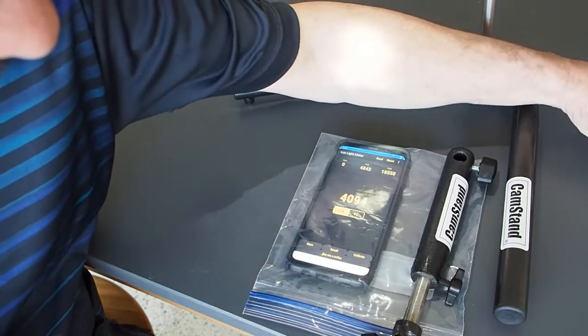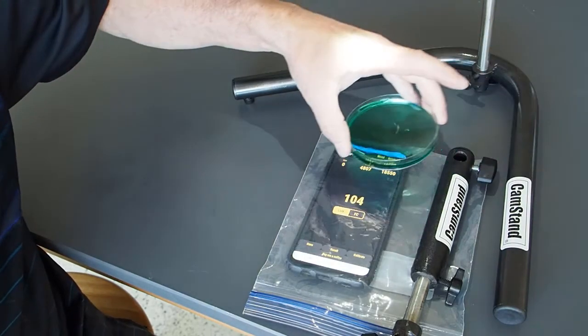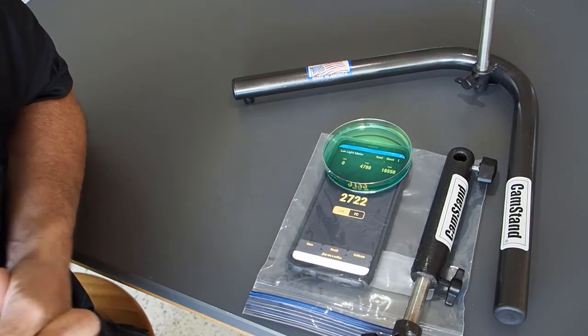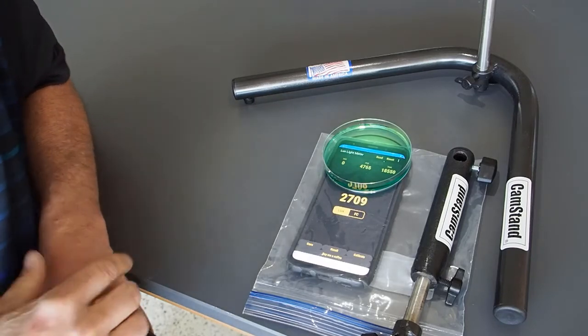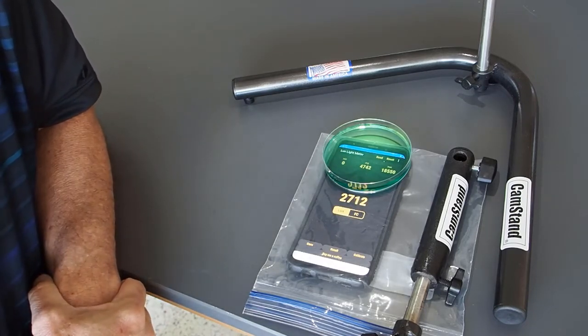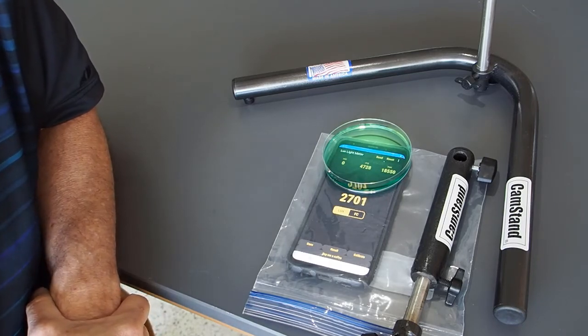Okay, do the same thing with the nickel nitrate solution. It's still 30 milliliters, so the same volume. And with the nickel nitrate dissolved, instead of around 4,000, we have 2,700. So roughly a third of the light has been blocked by the nickel nitrate dissolved in the water. So our proof of concept says, yes, you could make a spectrometer out of your cell phone. But you shouldn't, because it's dangerous for your cell phone. But at least you know it can happen.